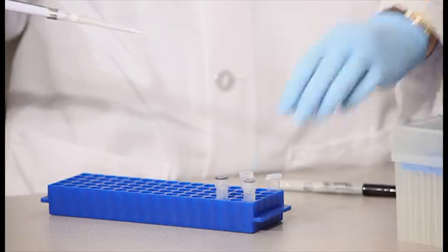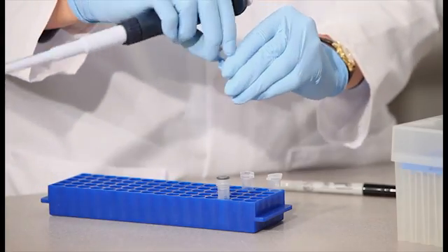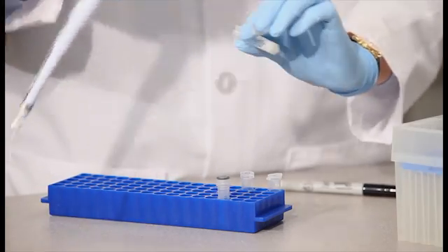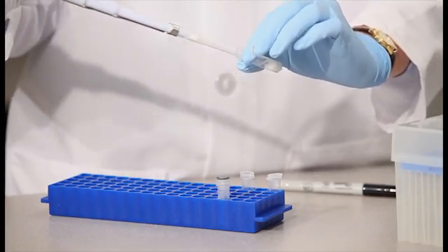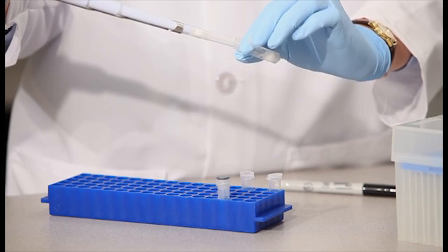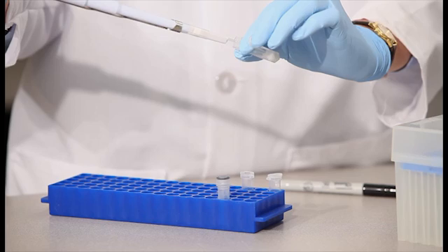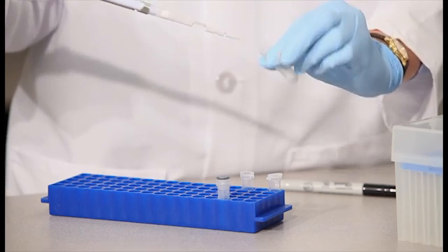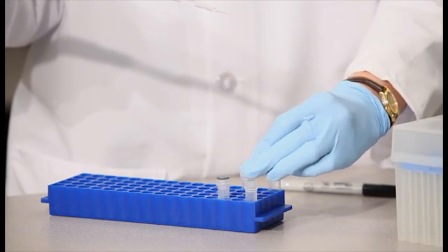Now, using a micropipette and changing tips between each sample, carefully transfer as much liquid as possible from each of the centrifuge tubes to the corresponding fresh tube you labeled in the previous step. Take care not to jostle the beads and filter to prevent picking up unwanted debris particles.